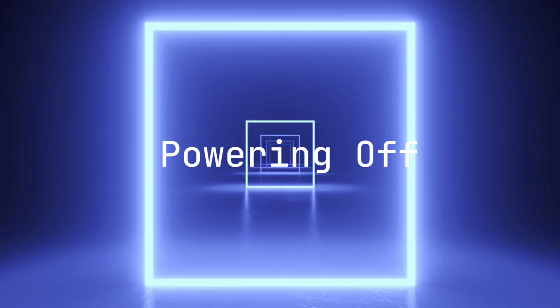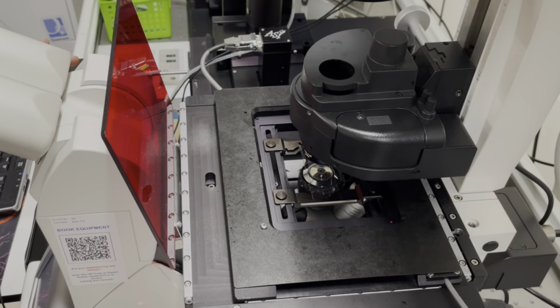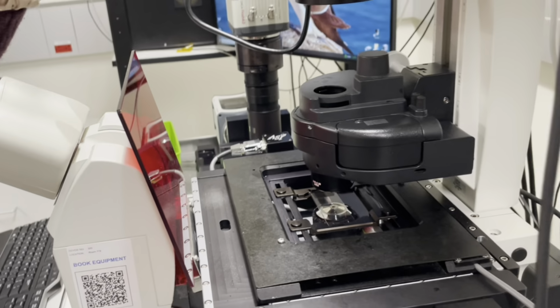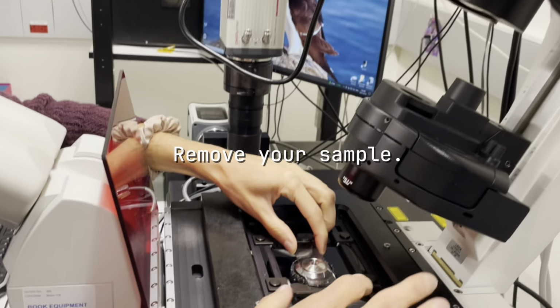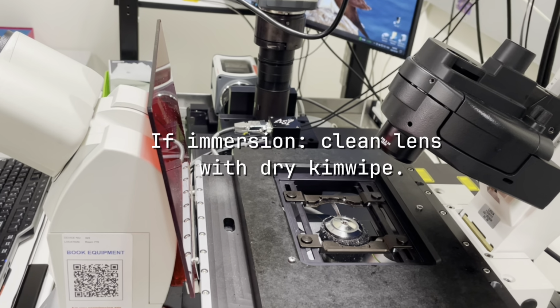Powering off. Before you power off the instrument, it's important to leave the microscope in a position or condition that will avoid collisions for the next user. The first thing you're going to do is remove your sample. If using immersion lenses, you'll have to clean them.